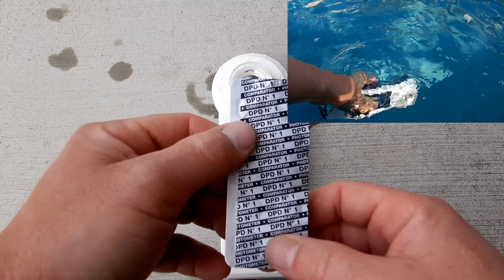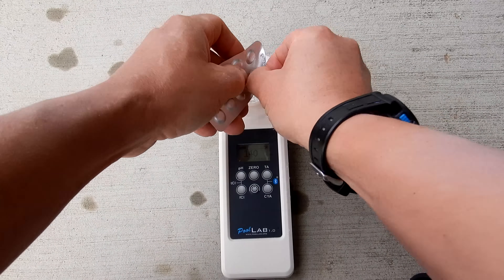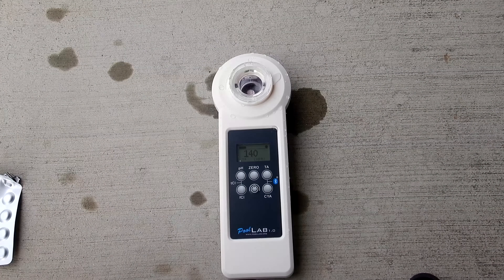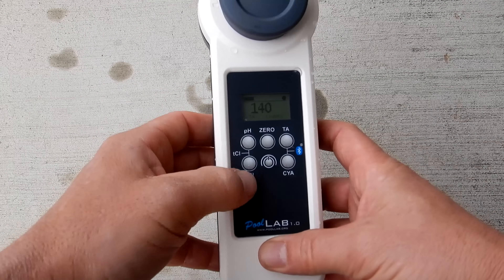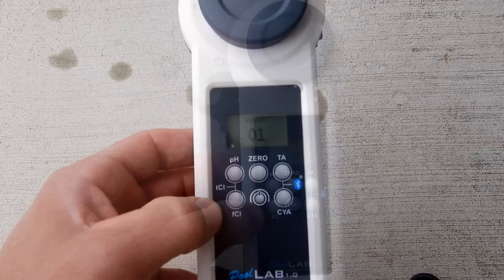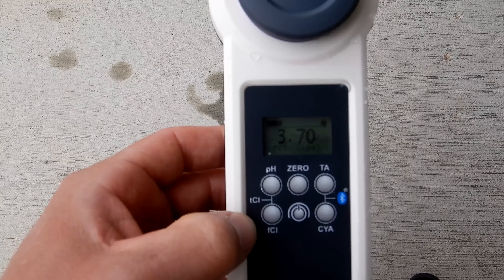I'm going to go ahead and do a test for free chlorine using the DPD-1. Let me drop the tablet in there. You can also do a test for combined chlorine and total chlorine next — I'll show you that. Simply cover it and go ahead and hit the free chlorine button, marked FCL. The free chlorine is at 3.7.